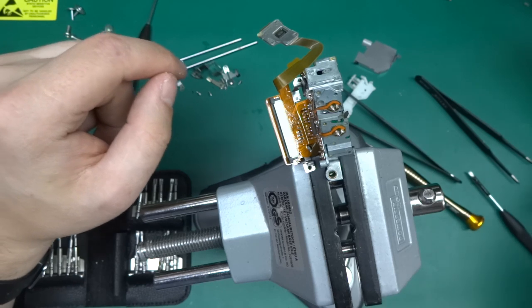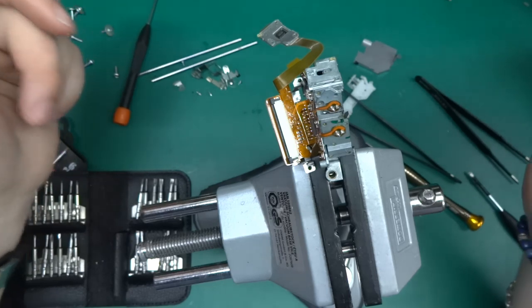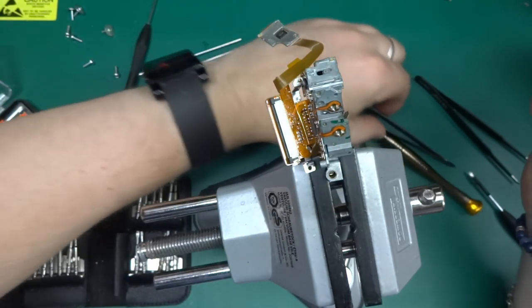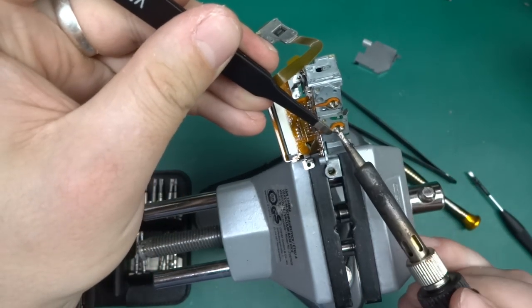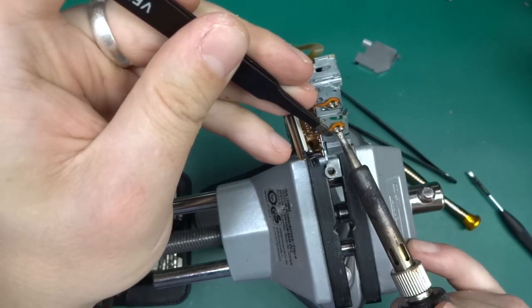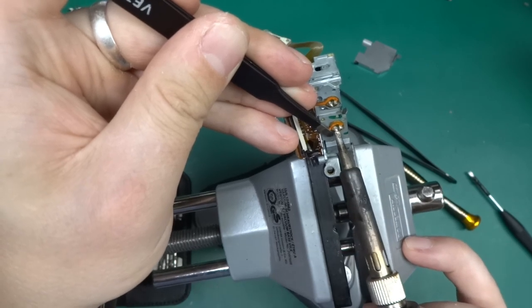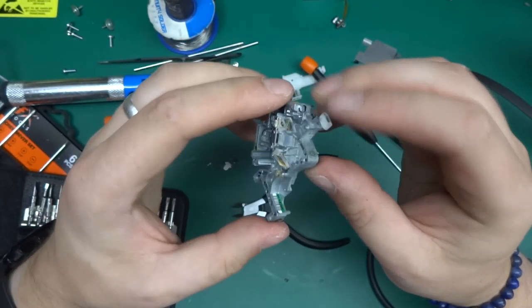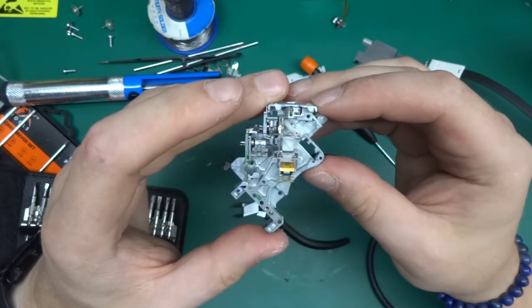Oops, my camera battery just died in the middle of a shot, so I hope it saved it properly, but I can't go back now, so it's too late. I've decided to actually desolder the laser diodes simply because it's going to make everything a hell of a lot easier. So I've got my iron set to 280. Let's see if that's going to be hot enough. You can see the color changing effect on the filter, so that's an interesting piece of equipment.